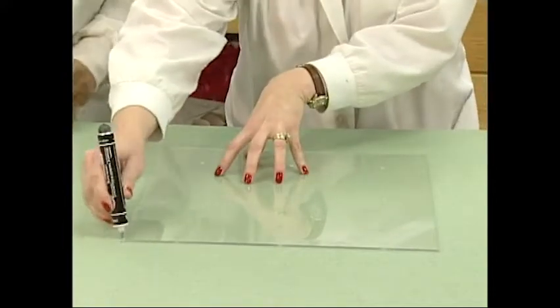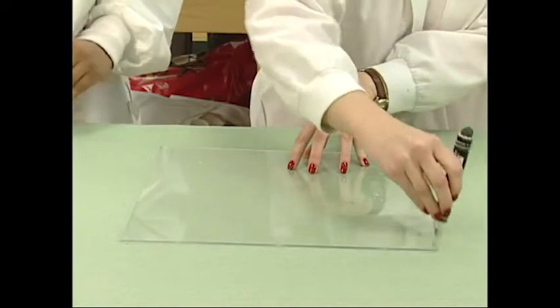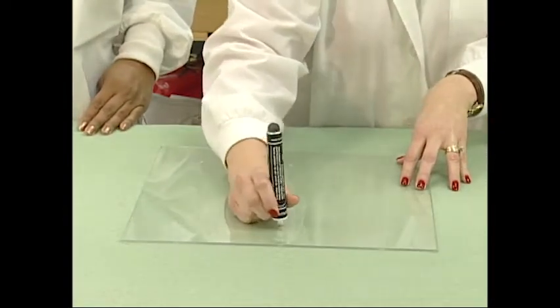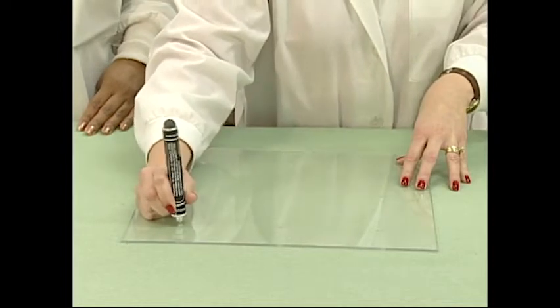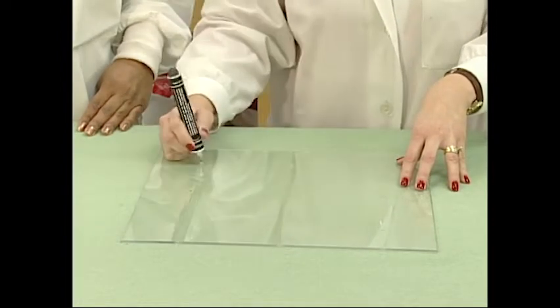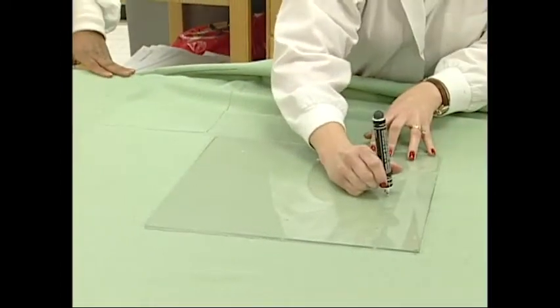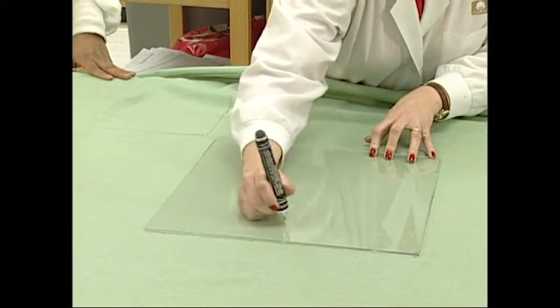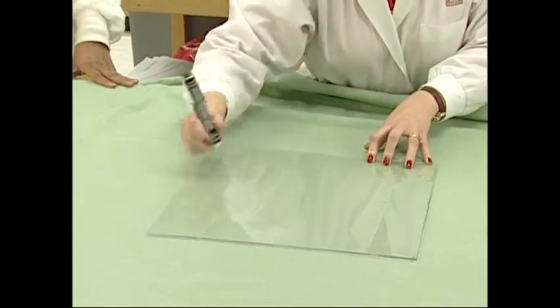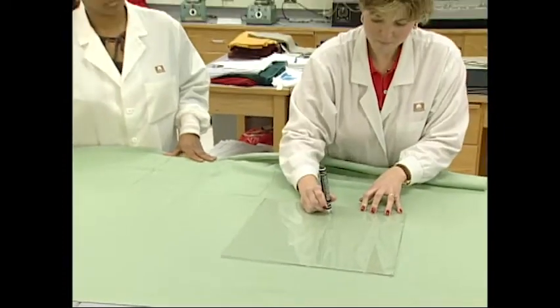Mark the outside edges of the template. Mark each specimen with three sets of length benchmarks and three sets of width benchmarks using a ruler, a stamp, or other suitable device. Make sure the ink used is indelible to laundering. Normally, 10 inch benchmarks are used as they make the mathematics easier to calculate. Some tests call for larger benchmarks which require the specimen to be larger than 15 inches square.